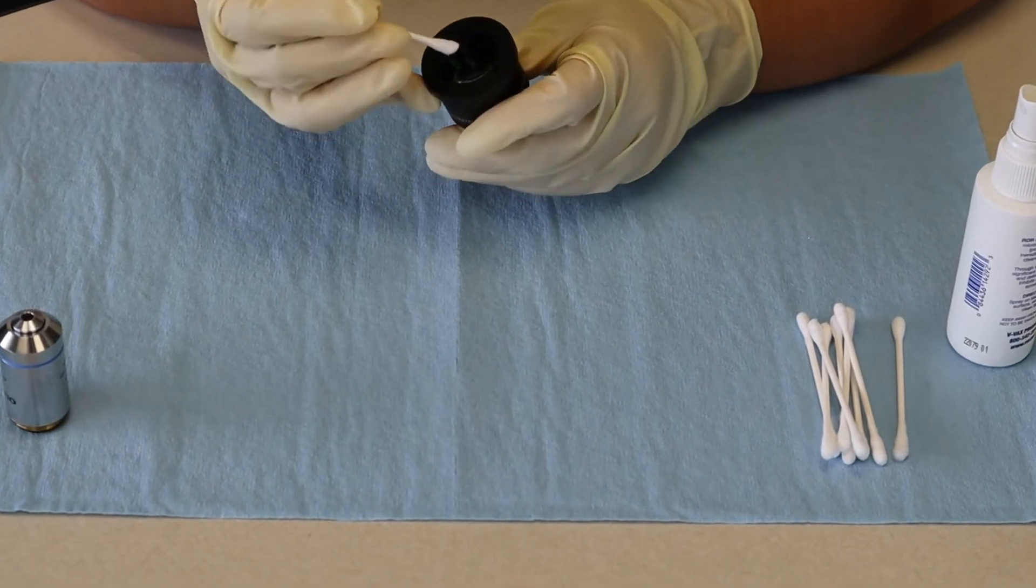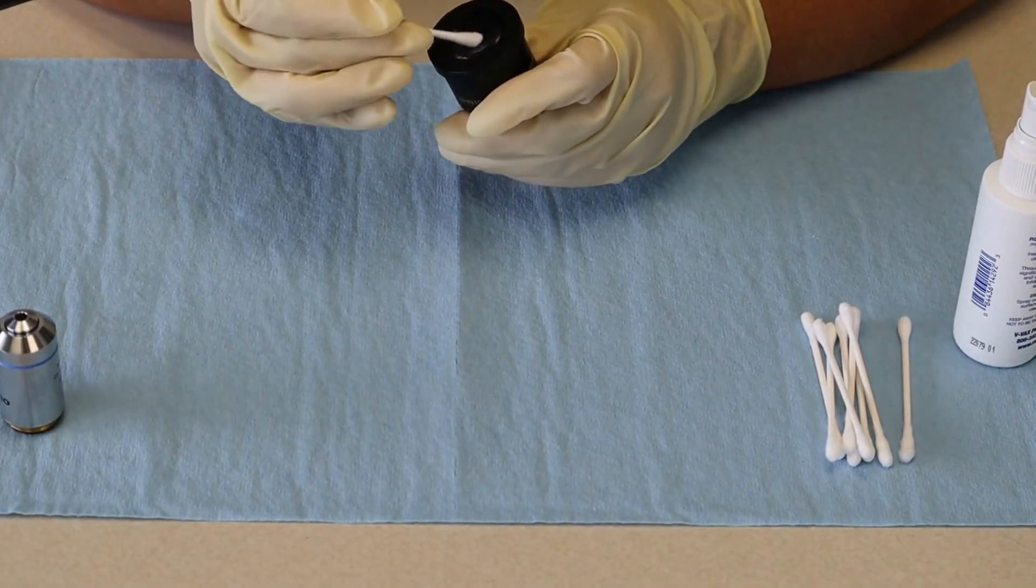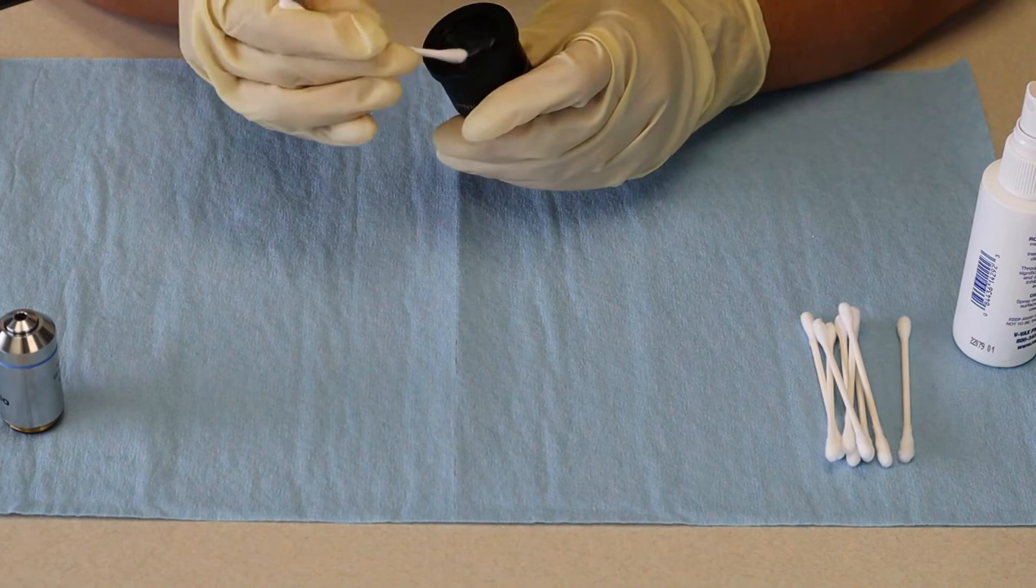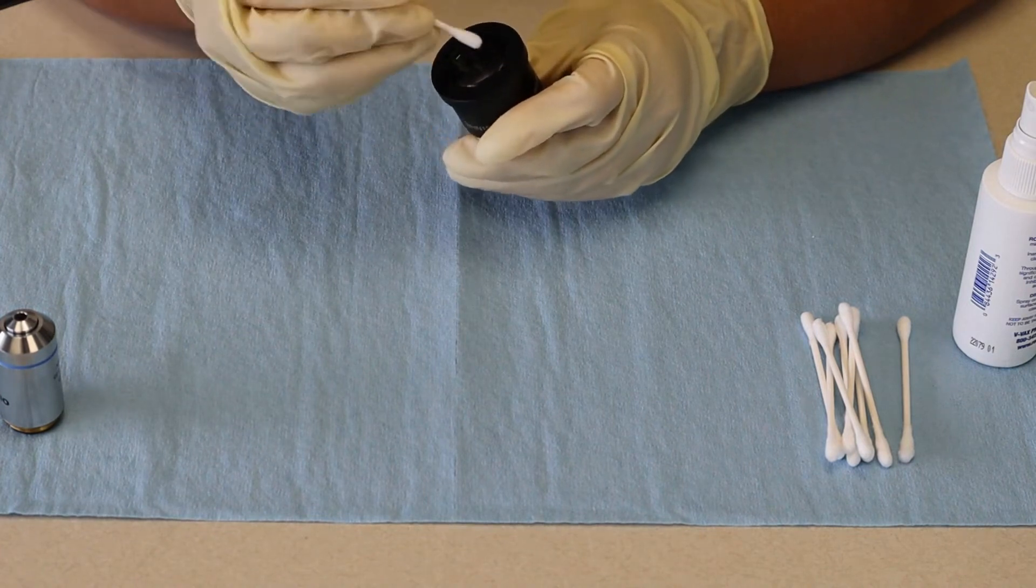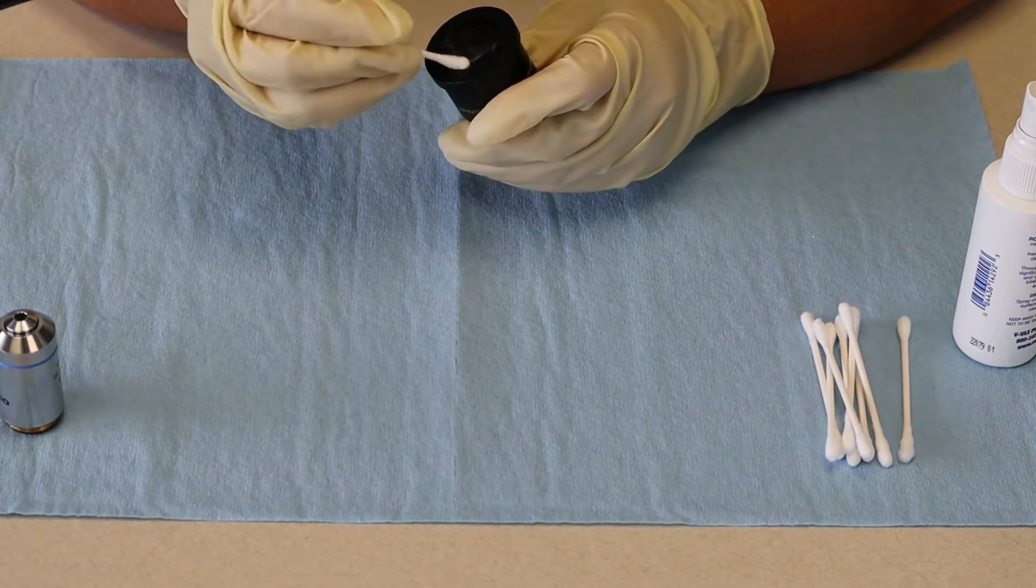Grab your eyepiece and in circular motions just clean, clean, clean. Get the other clean end of the q-tip and dry that off.